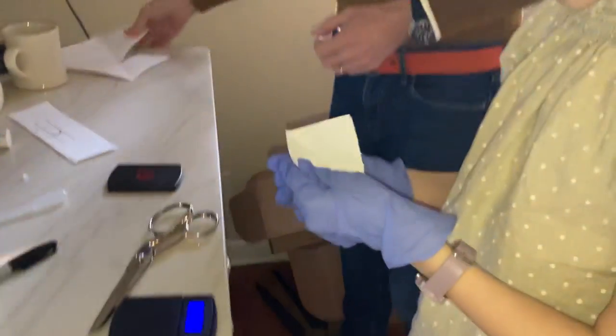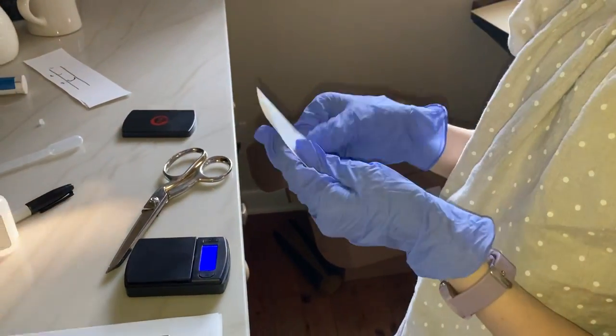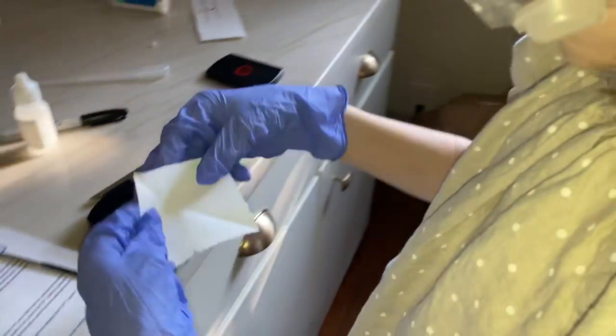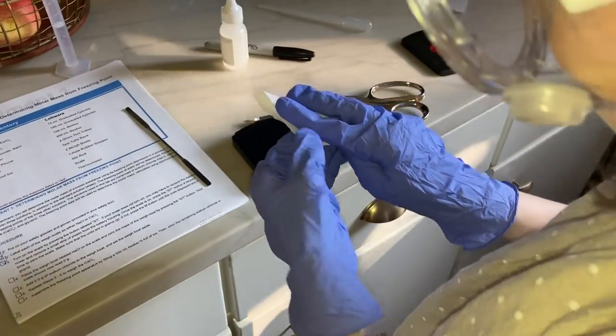Okay. You got it? Can you fold that? Sure. Thank you.